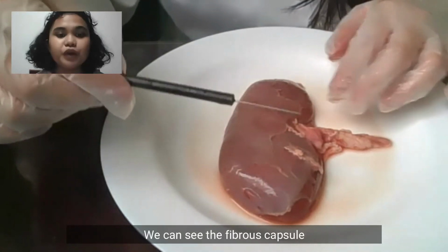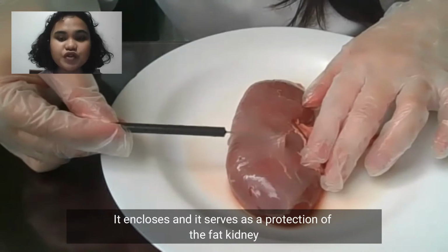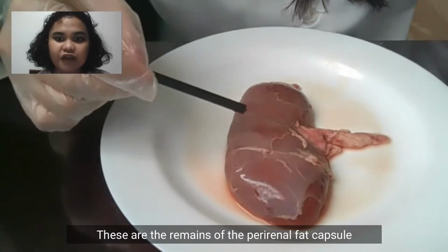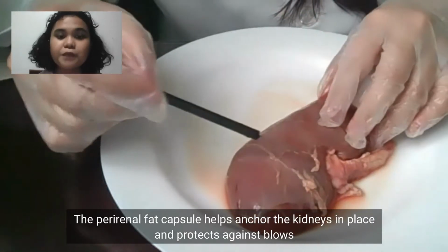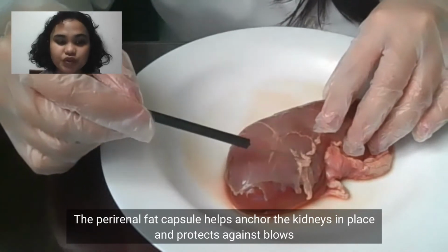Starting off, we can see the fibrous capsule. It encloses the fatty kidney and serves as protection. Next, these are the remains of the perirenal fat capsule. These are the fats. The perirenal fat capsule helps anchor the kidneys in place and protect against blows.